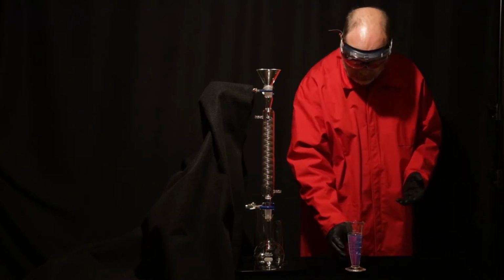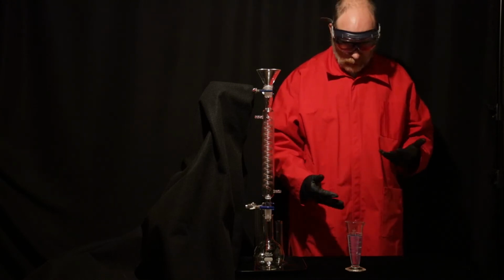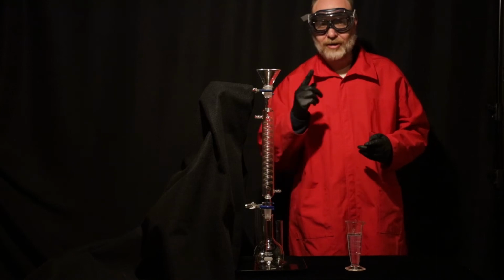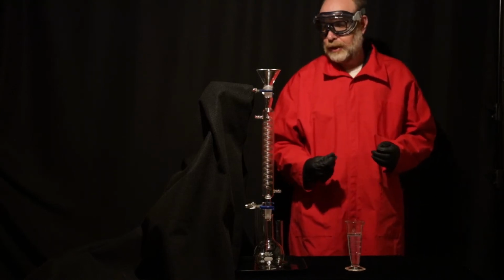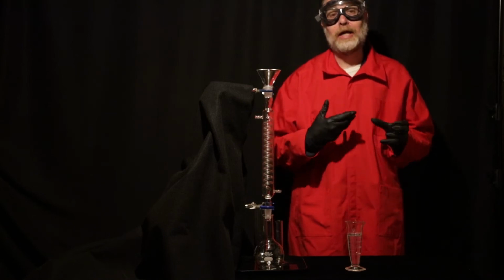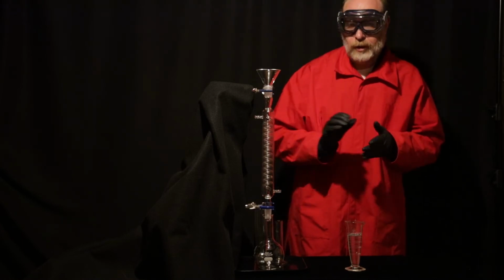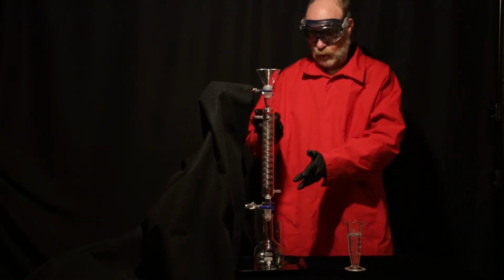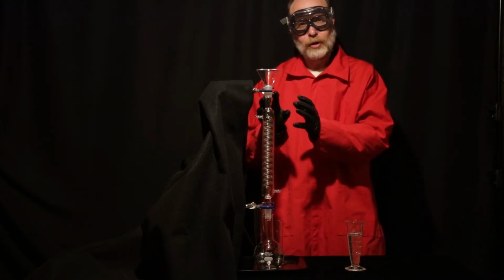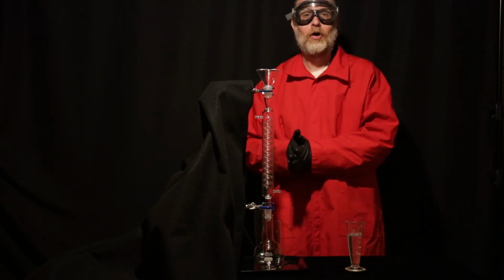Now, what I'd like to do is do that at a little bit grander scale. It's great to see the blue color, and that's really neat, but I'm going to put it through this tube that we call a condenser, a coiled tube inside. We use this sometimes in chemical reactions to keep things from evaporating, because this tube is cooled by a jacket of water. We can input water in these two positions, and we normally would use cold water for that, and it would cause the vapor that came from the chemical reaction below to condense and fall back in.